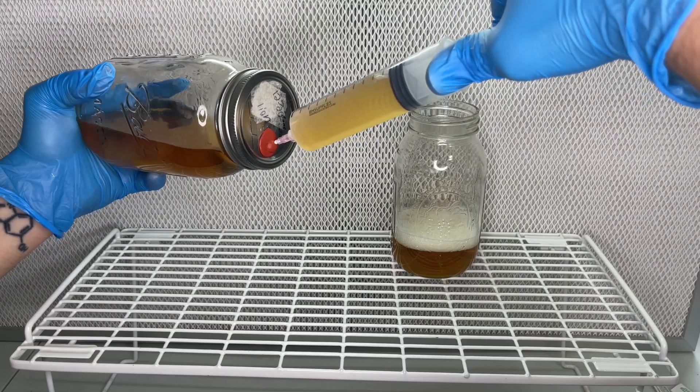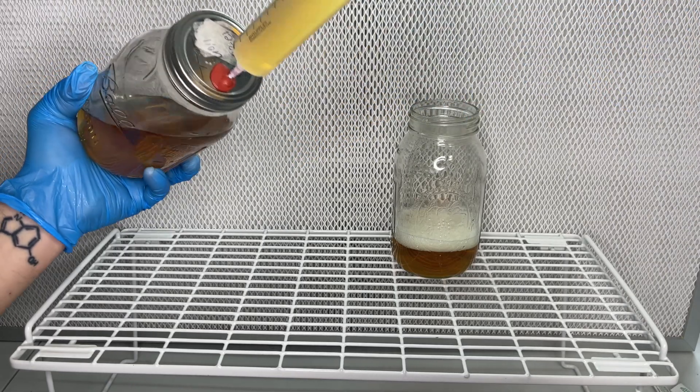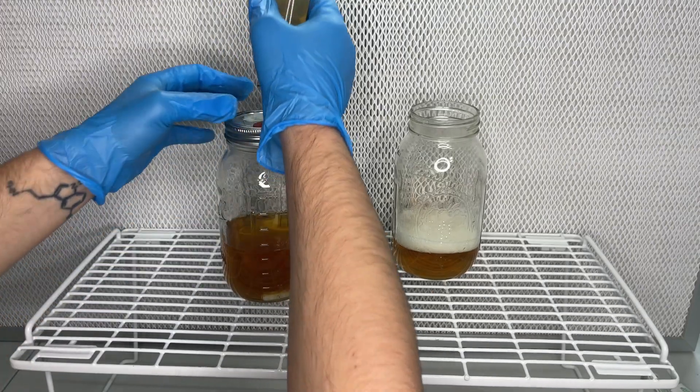And it usually takes a long time for the mycelium to settle to the bottom, so you'd just be sitting there waiting for that.